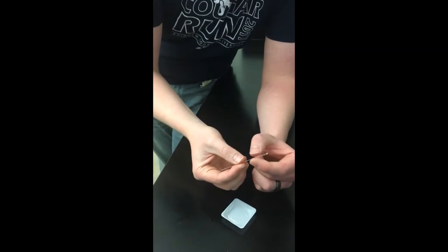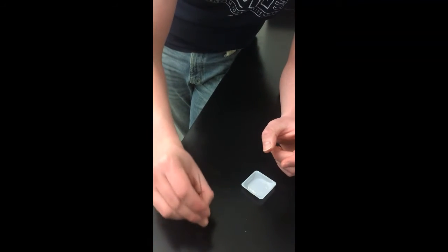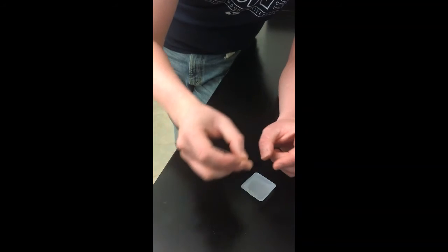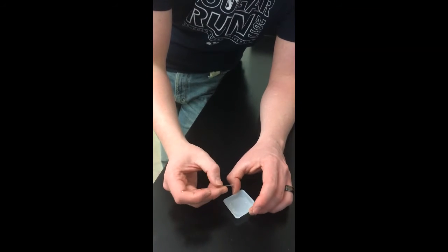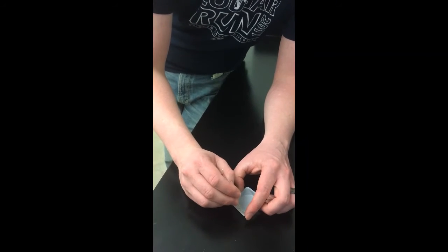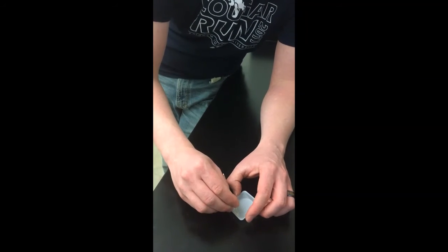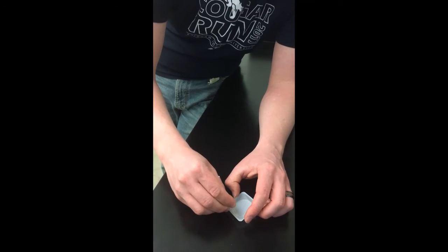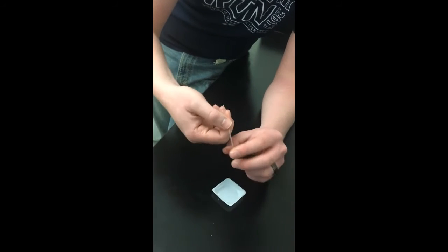Now, once I've got it inside the tube, I actually have to tap it down all the way to the bottom of the tube. And with this compound, it's relatively easy. So now you can see it's down there at the closed end. One thing, when you're preparing melting point samples, it's really critical to make sure that your crystals are really dry, that they don't have any water or solvent on them. Because if they have any water or solvent on them, that'll cause them to be really sticky, so it'll be really difficult to get it to pack into the melting point tube. But if they're nice and dry, they should pack relatively easily.